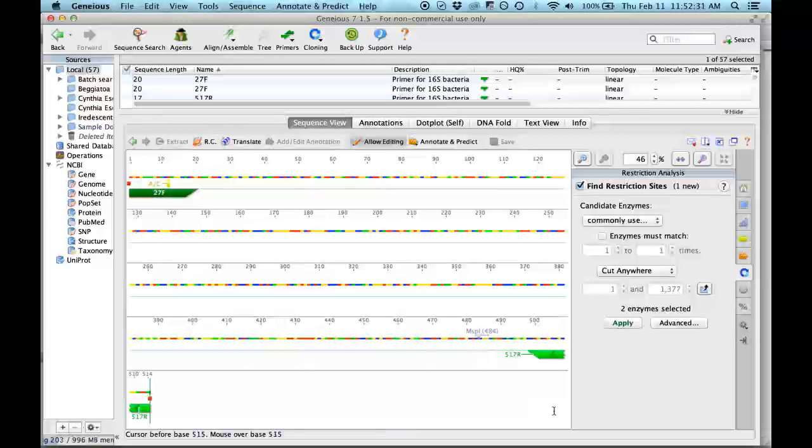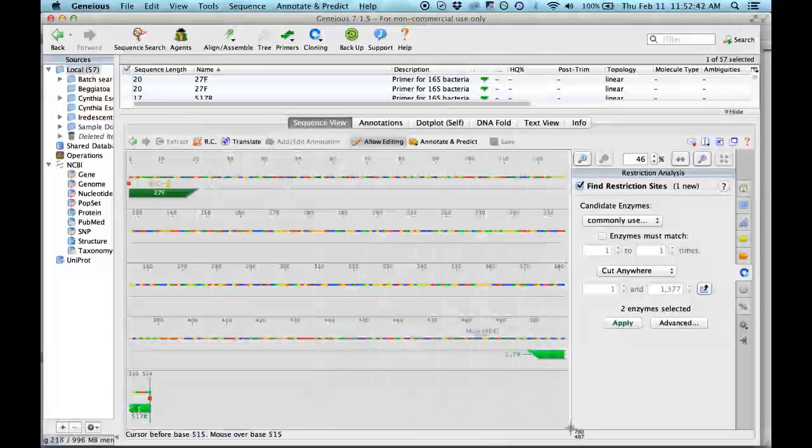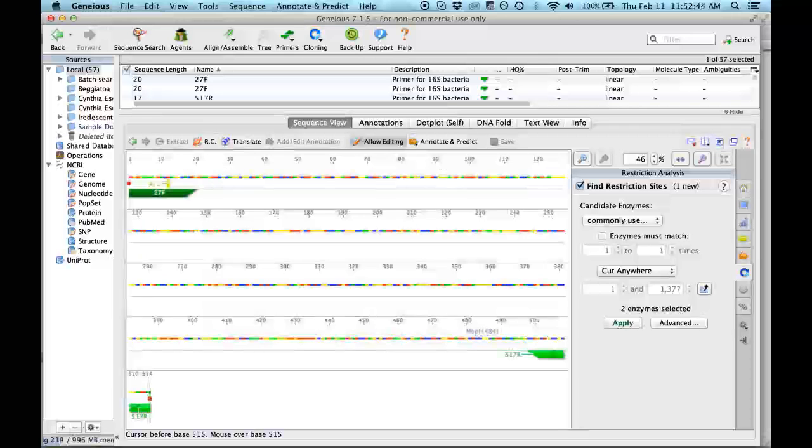So I can print screen for you here, and I can send you this, so you can replace the one that you have in your presentation.